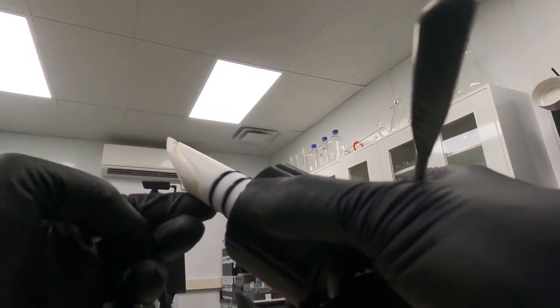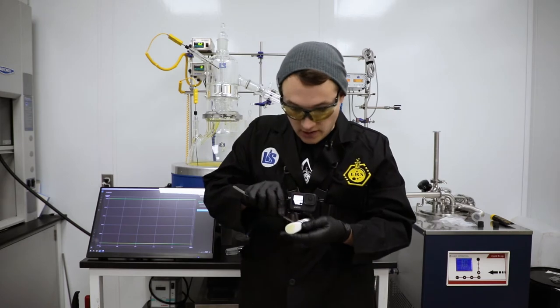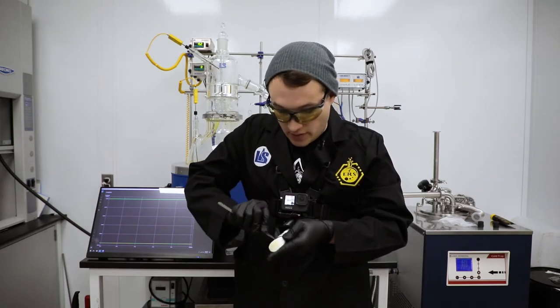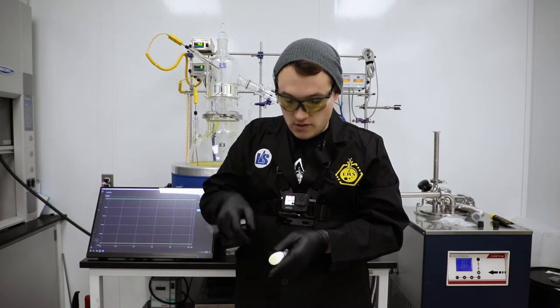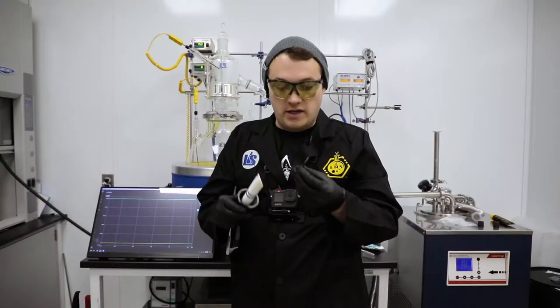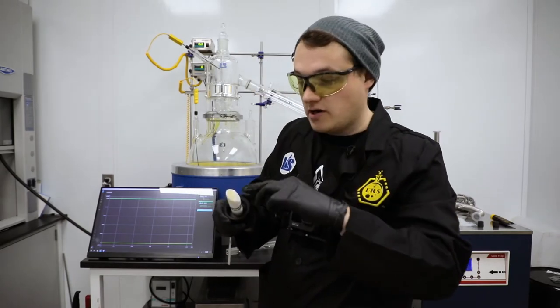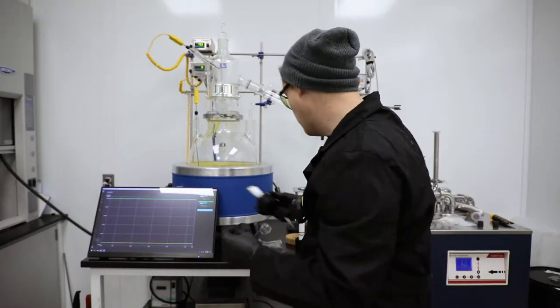These other o-rings can stay put — it's just that one that needs to come out for cleaning. I'll do this again on the second one so everybody can watch. I'm going to gently pop in from the side, pop it up, and then gently take my finger and pull it out. The key is not to stretch this o-ring. If it gets stretched, it won't fit snugly inside the trough that was cut for it.